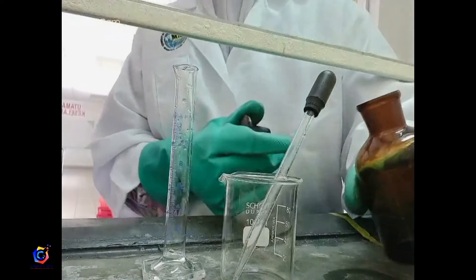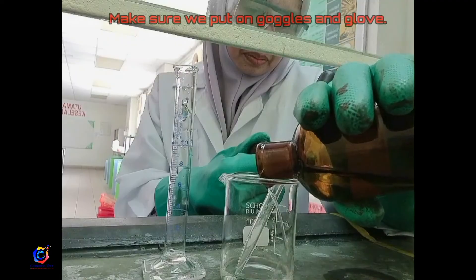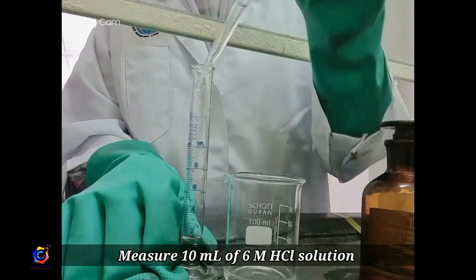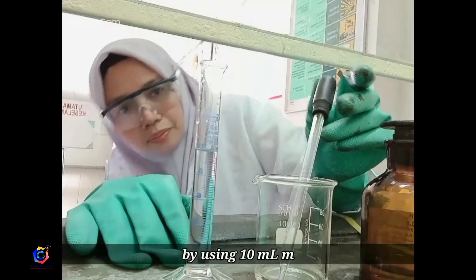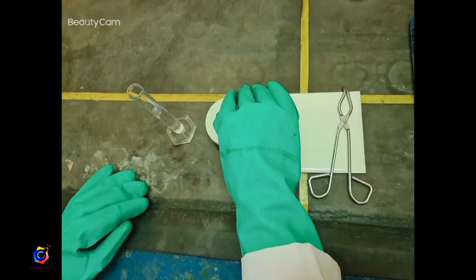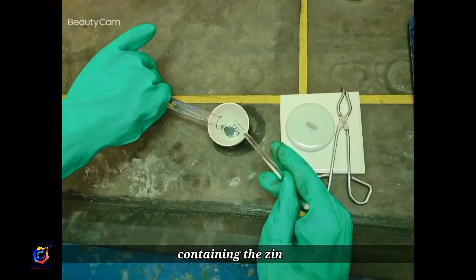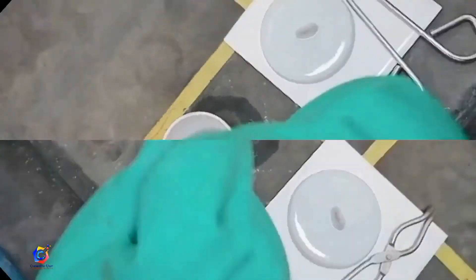The next step must be carried out inside the fume cupboard. Make sure you put on safety goggles and gloves. Measure 10 ml of 6 molar HCl solution using a 10 ml measuring cylinder. Carefully add the HCl solution into the crucible containing the zinc powder.